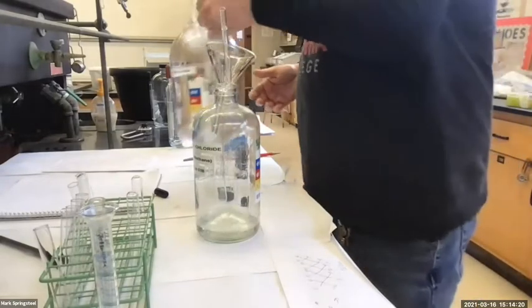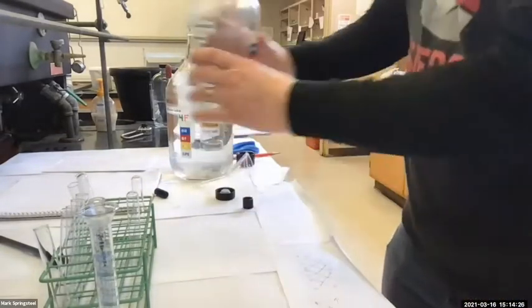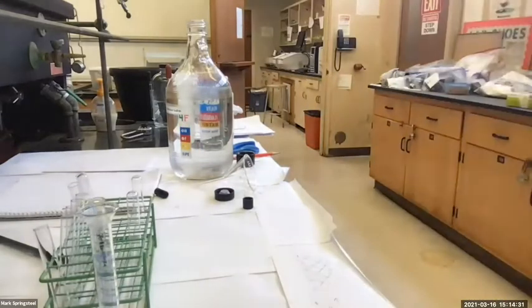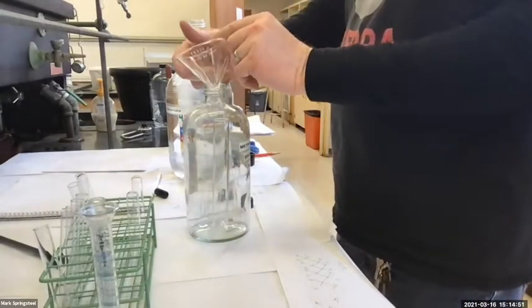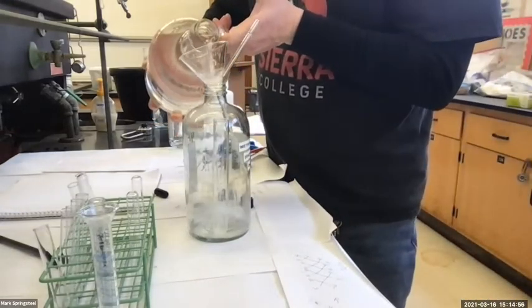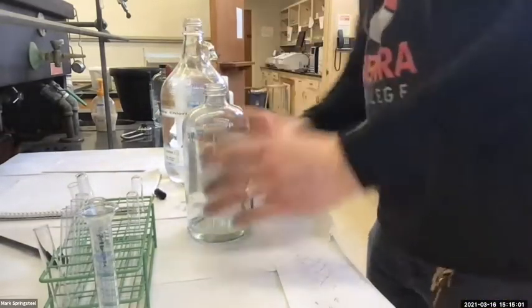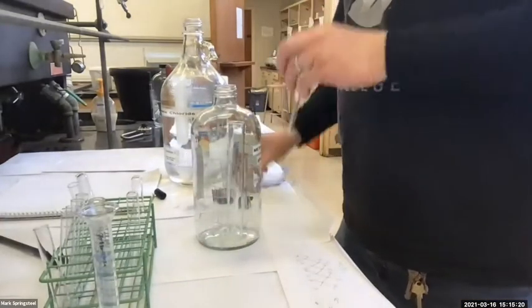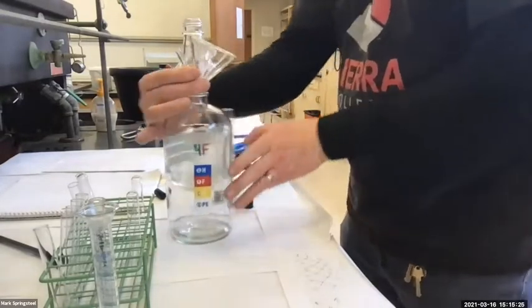At first, I'm only pouring a small amount. Set that down. I'm going to swirl this around to get out any more little rubber bits that might be in there, and put this in the waste container too. I'm going to do just one more of those. Okay. So I was just pouring that into the orange waste containers you saw in previous experiments. Okay, so now let's fill this up some.